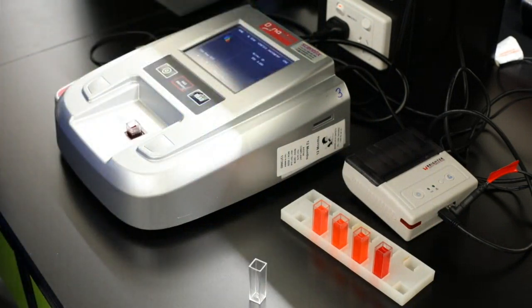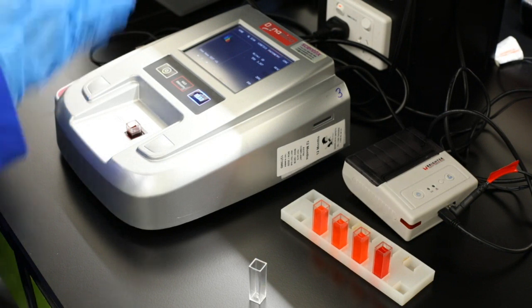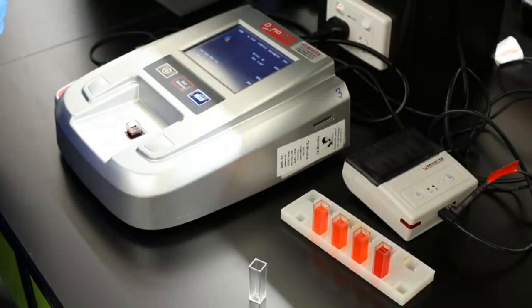And so it's measuring at the, and we get our absorption reading, because as that light carries through, what light can't get through will be our reading. So we got it at 3.307. If I was to go through all the different colours, you would see that we'll be getting different readings through. So I'm going to hand back to Jeremy now.